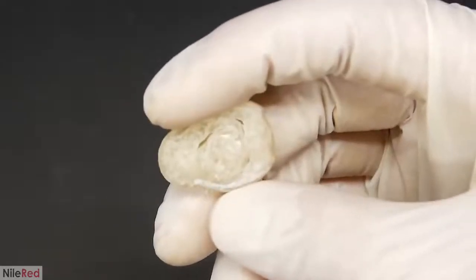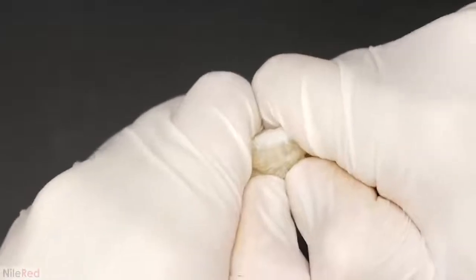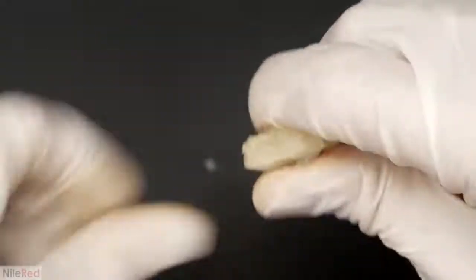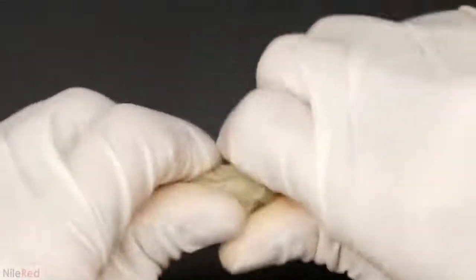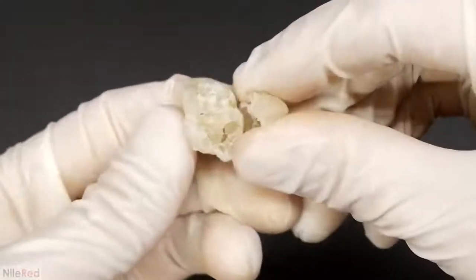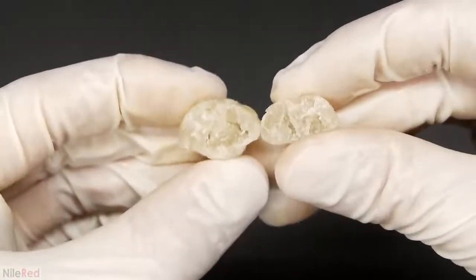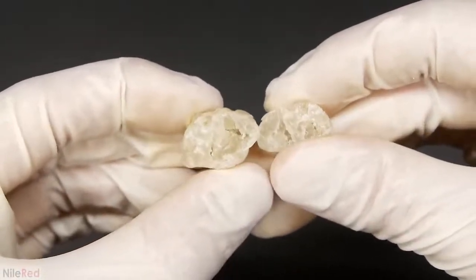The ladybug was a lot tougher, and it took a lot more effort to break. When I finally got it open though, you can see that it's not solid inside, and there are many hollow spots. This clearly isn't the best way to mold cellulose acetate, and it's the reason why it's usually just melted instead. Then the liquefied form is either extruded or injected into a mold.